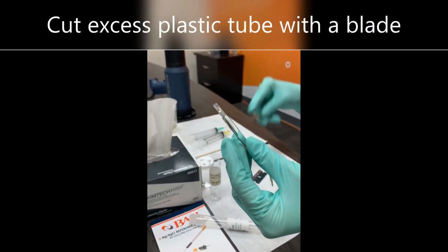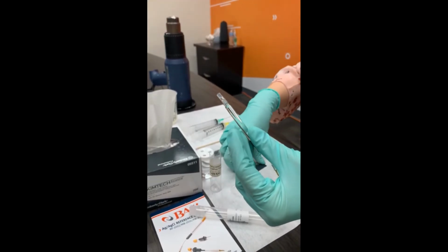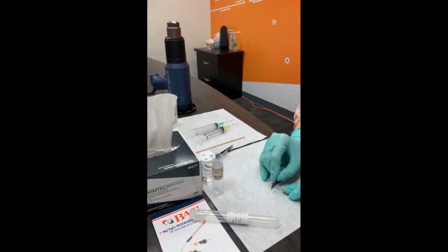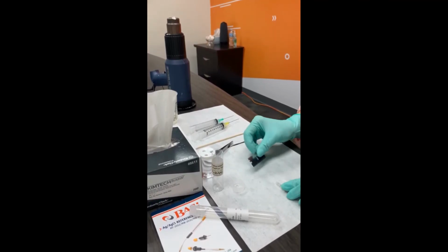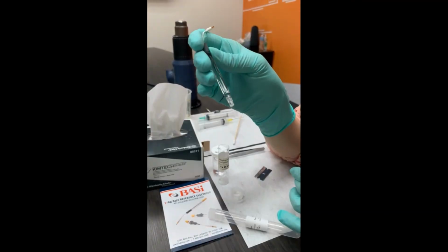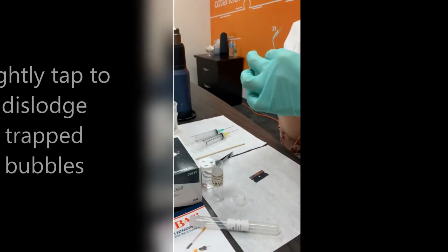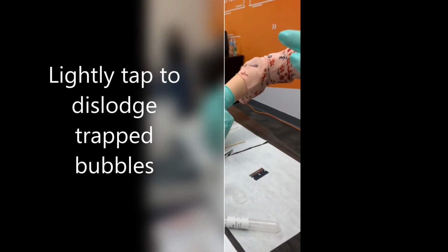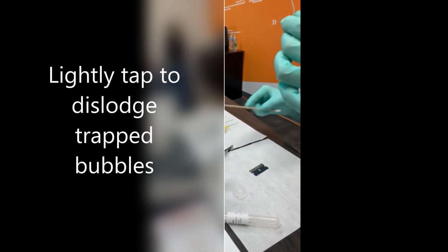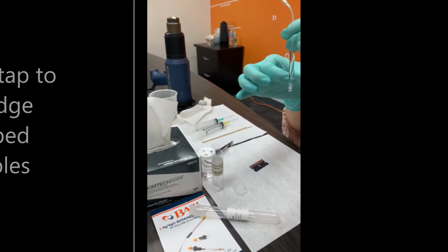Notice how there is an excess plastic tube up here. You can just easily remove that by cutting it using your blade. Make sure that there are no bubbles trapped in there. If there are, you can just lightly tap to get rid of it. Or even with your finger.